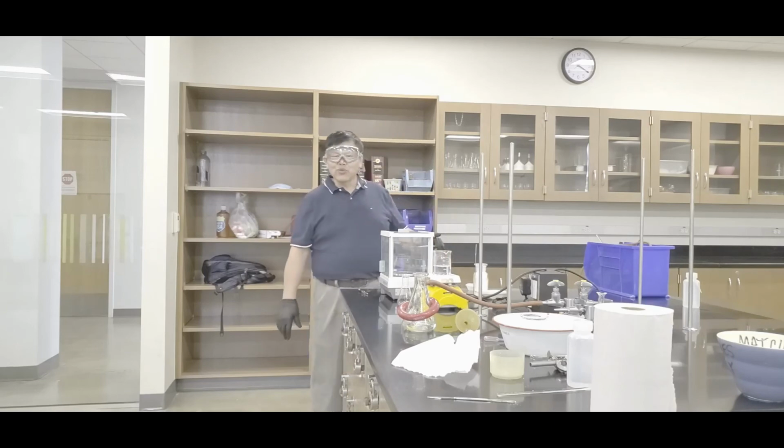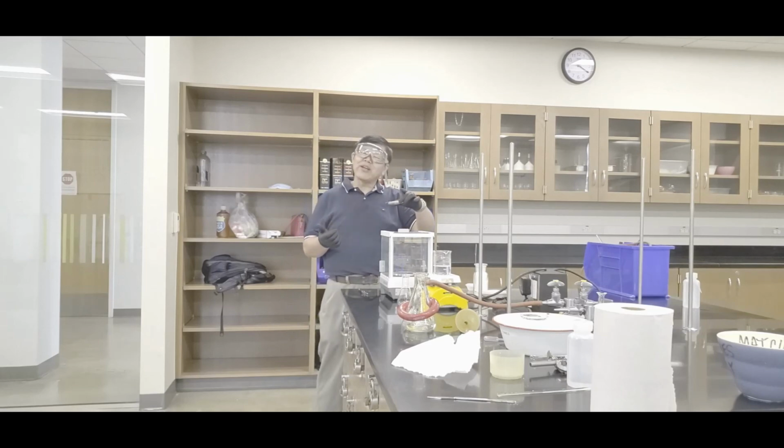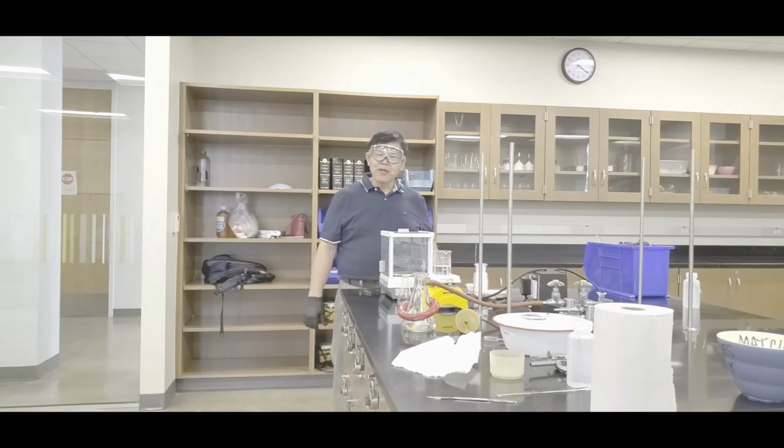Here's one thing, some students will go like that, just stick that in there, that's how you get a 3,000% yield, because you have now got the watch glass in there that you did not account for last time, okay? So anyway, we just did the first week. Second week, when you come in, and this is dry, zero the balance, open the door, watch glass in one hand, and then get the tweezer and pull the paper, and there's your mass. That'll be the mass of your aspirin plus filter paper, okay? So in that case, hey, yippee-yay, we're done.